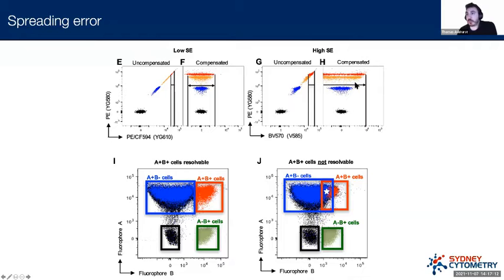Why is spreading error important? Two cases down here paint a picture of when it's irritating but not necessarily a problem versus when it's actually going to mess with the experiment. In this case, if we imagine fluorophore A versus fluorophore B, as fluorophore A gets brighter, the signal starts to spread, and so it starts to contaminate our fluorophore B detector. If we then look at cells that are positive for both A and B, in this case, we can pretty much resolve them. They do still separate. So you can see the single positives in blue and green and the double positives in red. So actually, this doesn't look too bad. We can probably deal with this problem without it causing us too much of a headache.